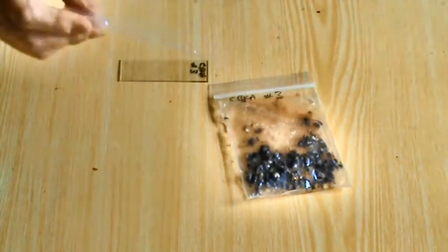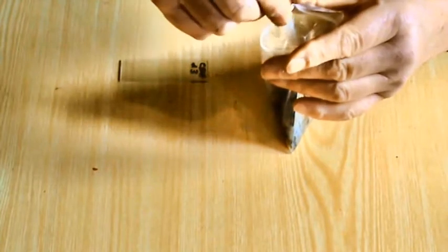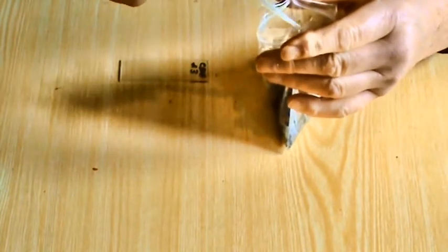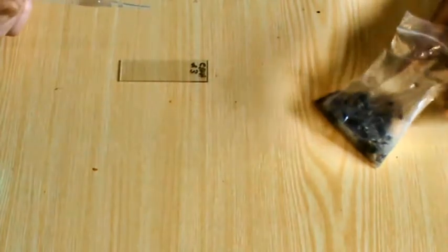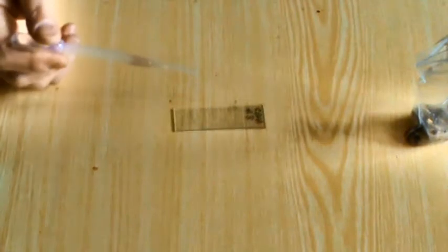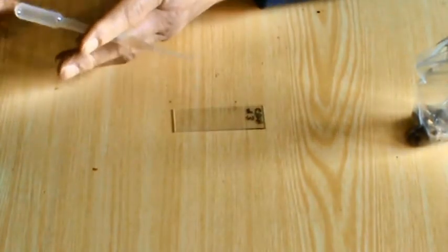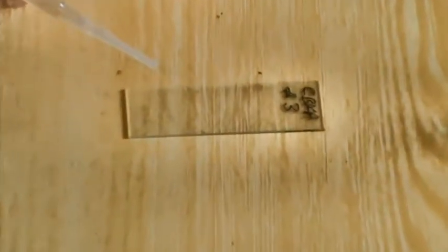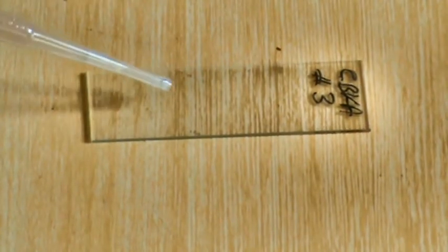And then using a clean pipette, which are extremely cheap if you buy them by the hundreds off the internet. We're just going to put a little drop of water. I'll just zoom in to see if you can see how much I'm going to put on. There we are. That's it, onto the slide.